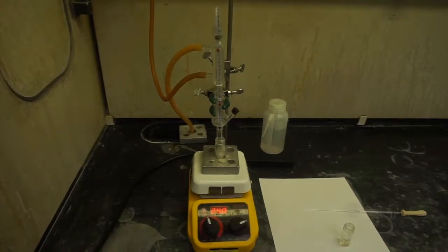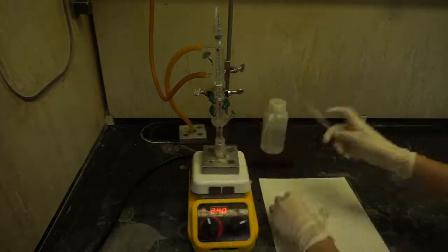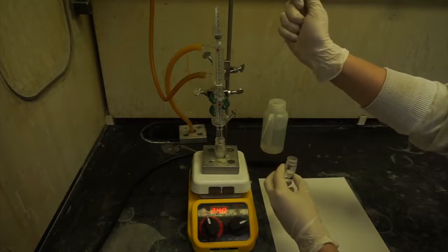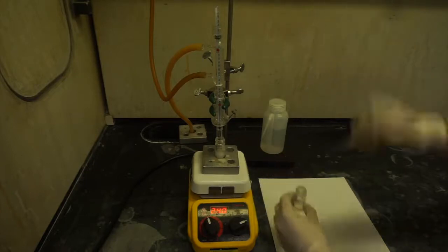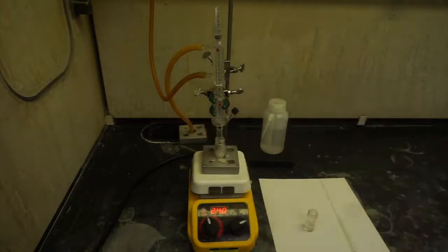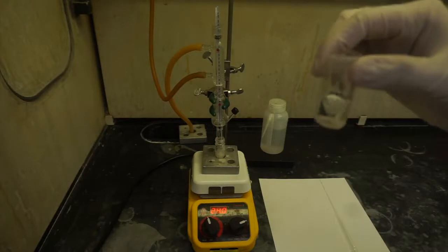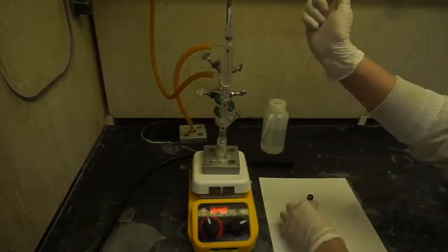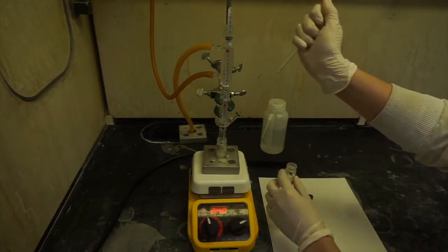After 1 hour reflux, now collect all condensates formed inside the Hickman still. You can collect the condensates by using a long Pasteur pipette and gently draw out the liquid into a separate 3 milliliter conical vial. Repeat this process until there's no more condensate forms.